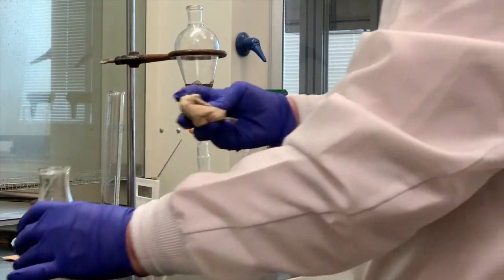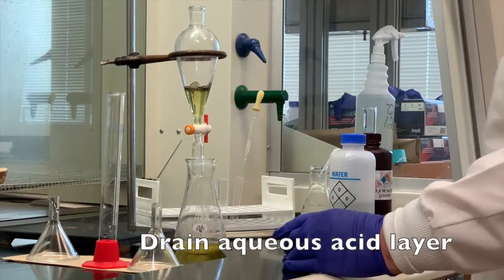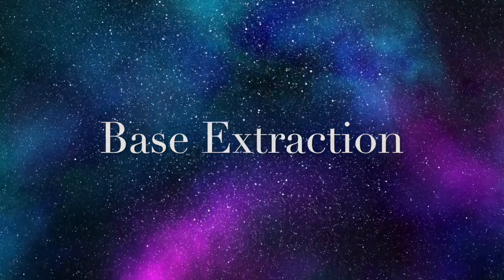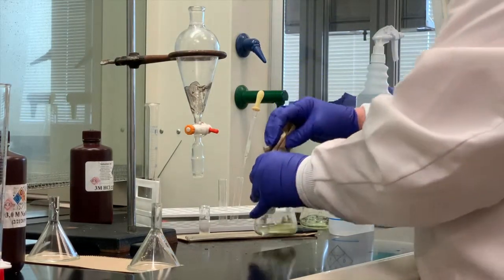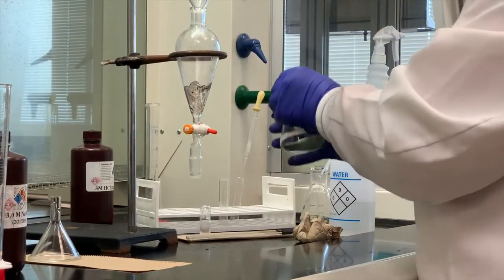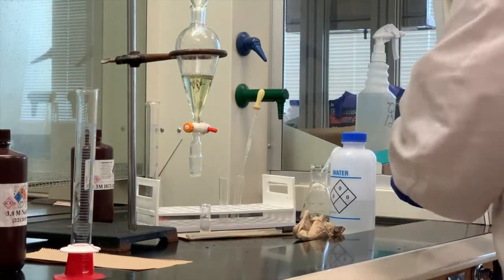Okay, so this is my neutral organic that still has the benzoic acid in it. So I'm going to combine all the aqueous acidic layers. Now what we want to do is to use the sodium hydroxide. I've got a clean cylinder, and I've got my 3 molar sodium hydroxide. What I want to do is pour my organic layer back into the separatory funnel, again making sure everything is closed. And I'm going to measure out roughly 15 to 20 mils. I'm going to get a new clean funnel for that.